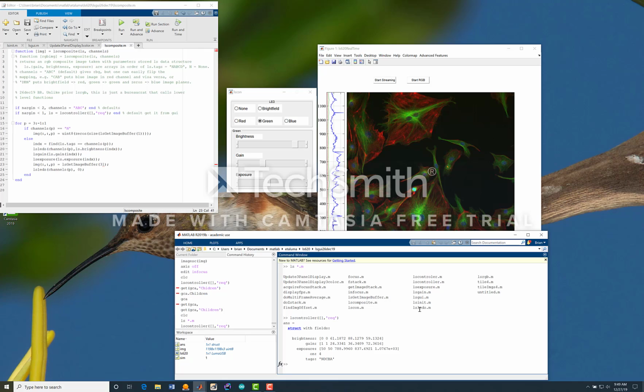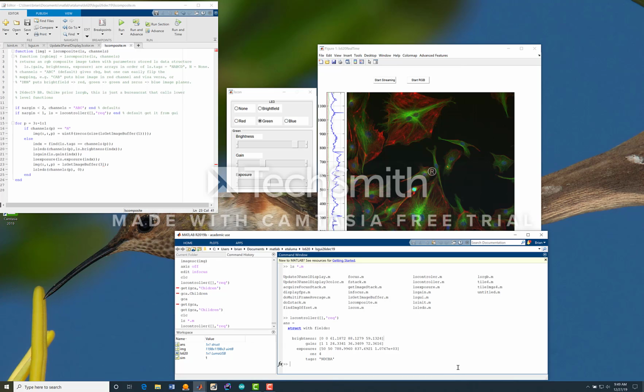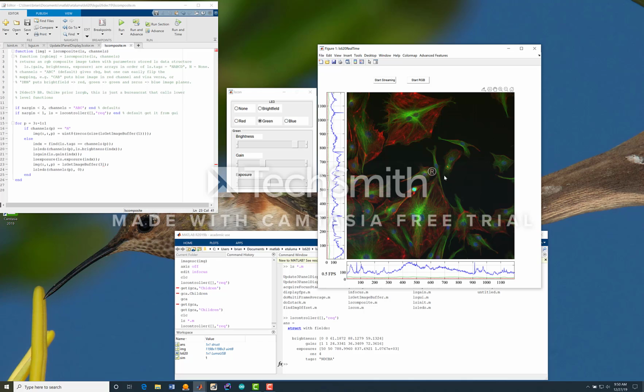The rest of these are low-level functions to set the gain, initialize, set the LEDs. ls GUI generates and is the bureaucrat that runs this GUI, and tile is another advanced feature here. So those are just a handful of functions, most of them very small, that handle all the busy work. And again, the cool thing is it's in the environment.